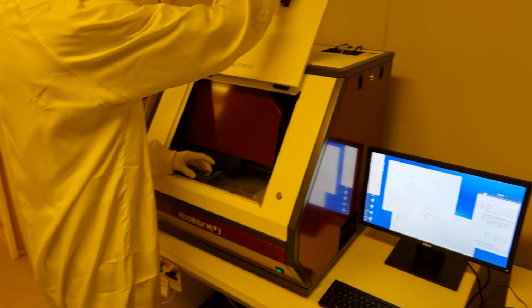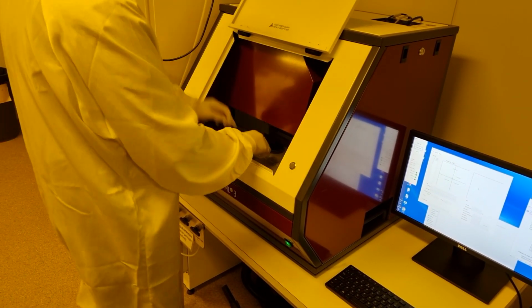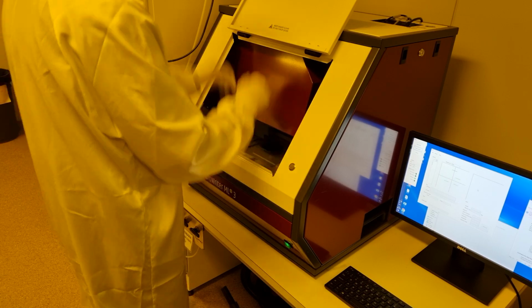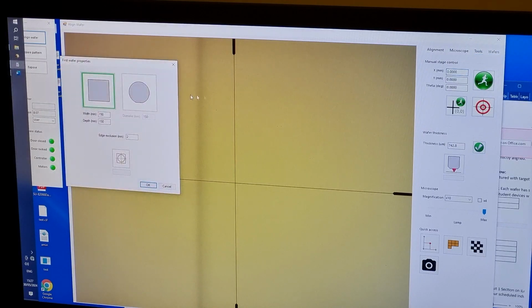Load the wafer into the center of the pattern writer, with the same orientation it had when you exposed the first layer. The DMO software should launch to the Align Wafer screen. Under the Wafers tab, set the current wafer properties to match your substrate. We are using the same 76mm or 3-inch wafer.